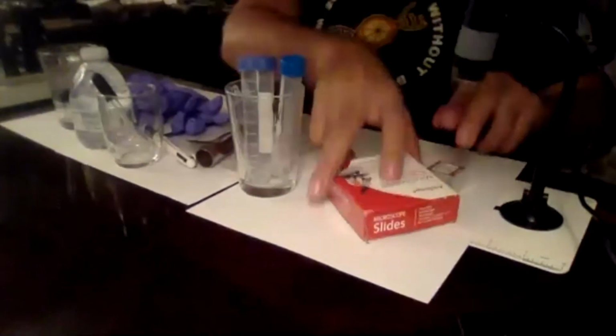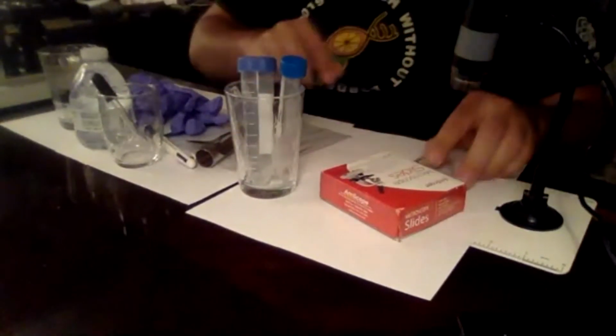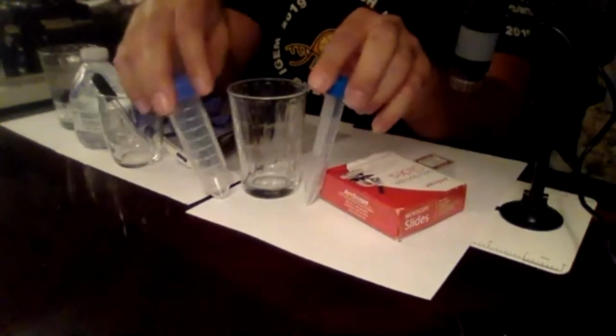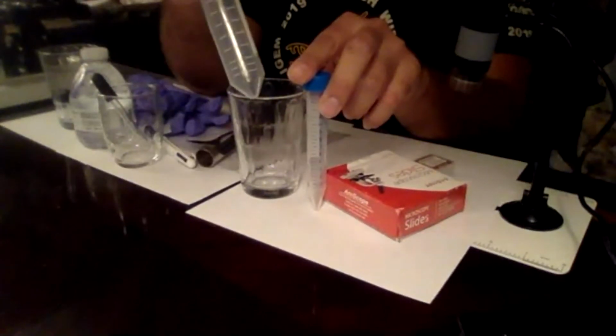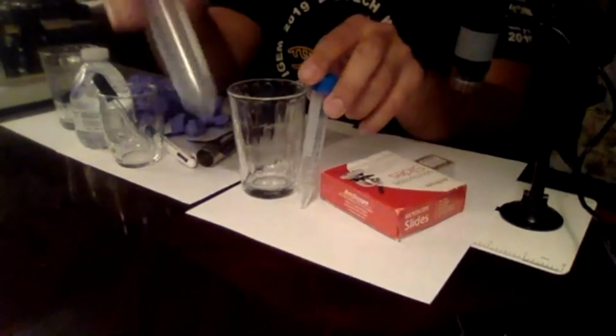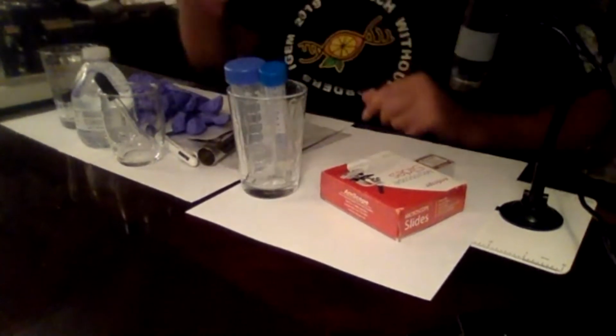Okay, so we'll walk you through the equipment in general. We're going to want our microscope slides, obviously. We're going to want some cover slips. We're going to want some test tubes. You can use a glass of water as well. It just helps to understand what your volume to mass ratio is. If you have a lot of bacteria in your soil, you need to dilute it to really do counts, but we'll simplify it here.